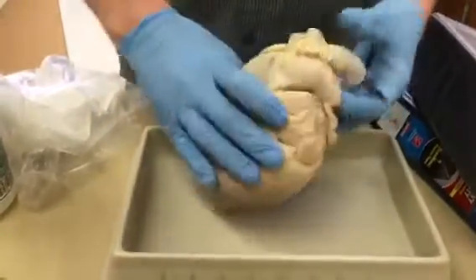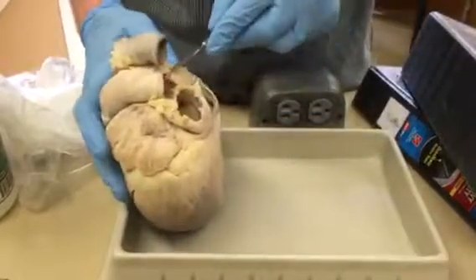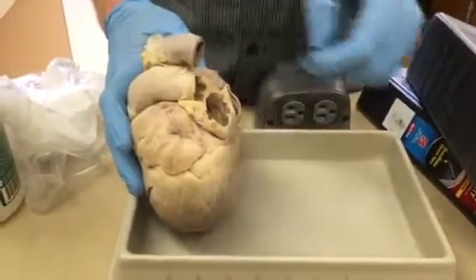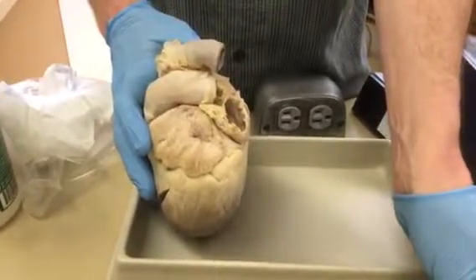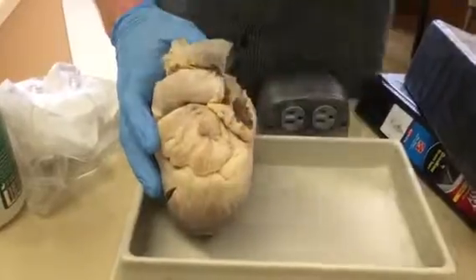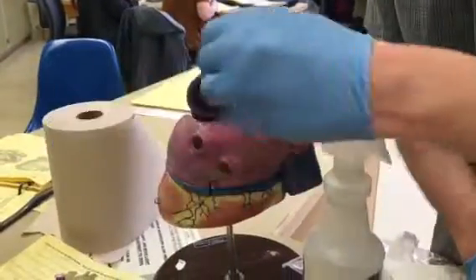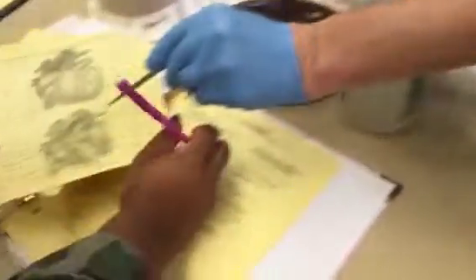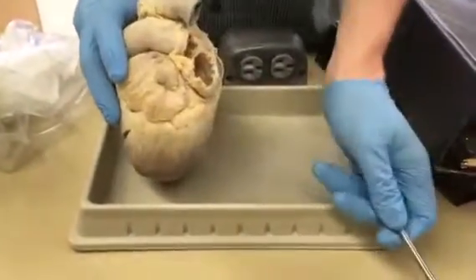Okay, then we have the pulmonary trunk, which is this guy, and it would branch off into the right and left arteries, and they are not shown either. So there'd be one here and there'd be one there. So on this particular one, that's why we don't have right or left. We just say pulmonary trunk. Okay. So where is it in that model? So on this one, they don't have it either. Oh, okay. It would go here and then one, one. On your picture in your book, they show one here and one here. Okay. See that? Those are the arteries there. Okay? So you don't have to deal with that.